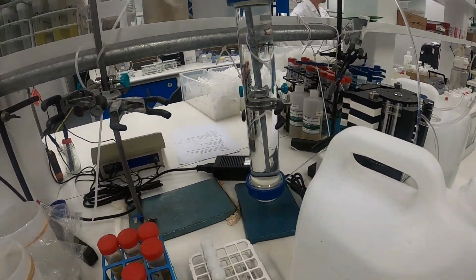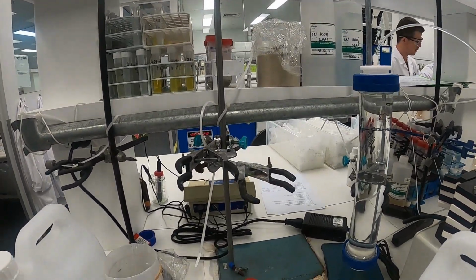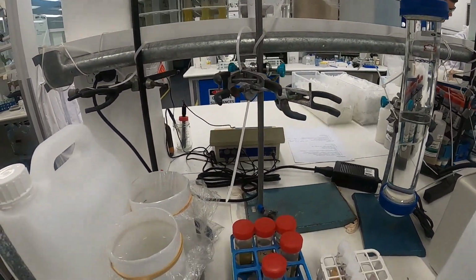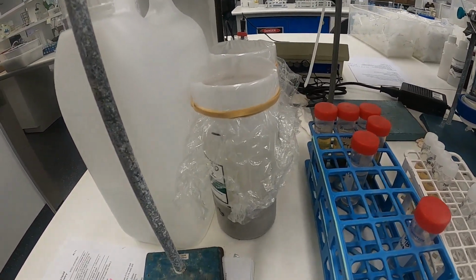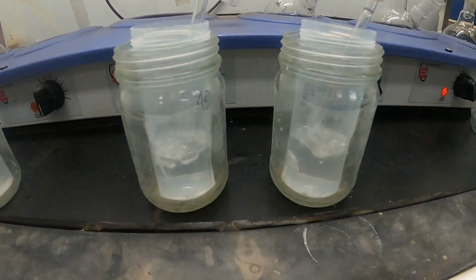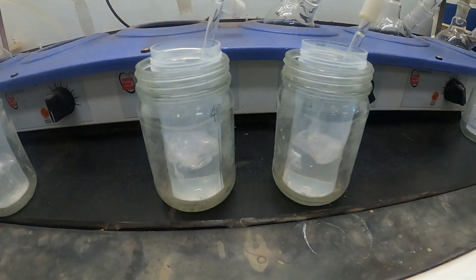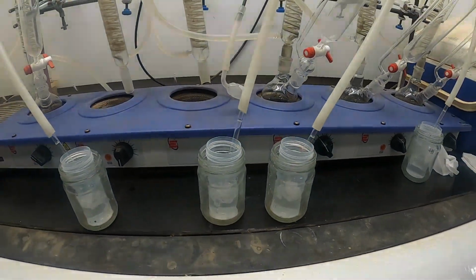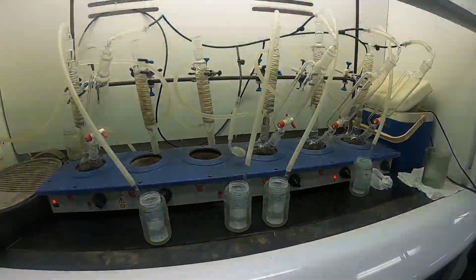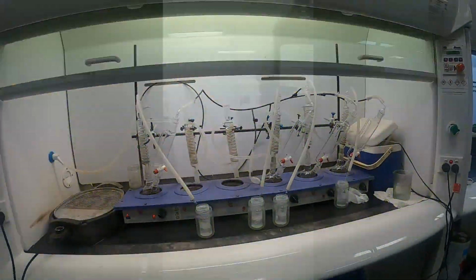Here we pack a column with soil and pump generally site water up through the column, not down through it, and slowly leach out any contaminants. This is acid sulfate soil analysis, and here we're using a distillation apparatus for chromium reducible sulfur. With acid sulfate soils, you can choose either a SPOCAS suite or a chromium reducible sulfur suite.